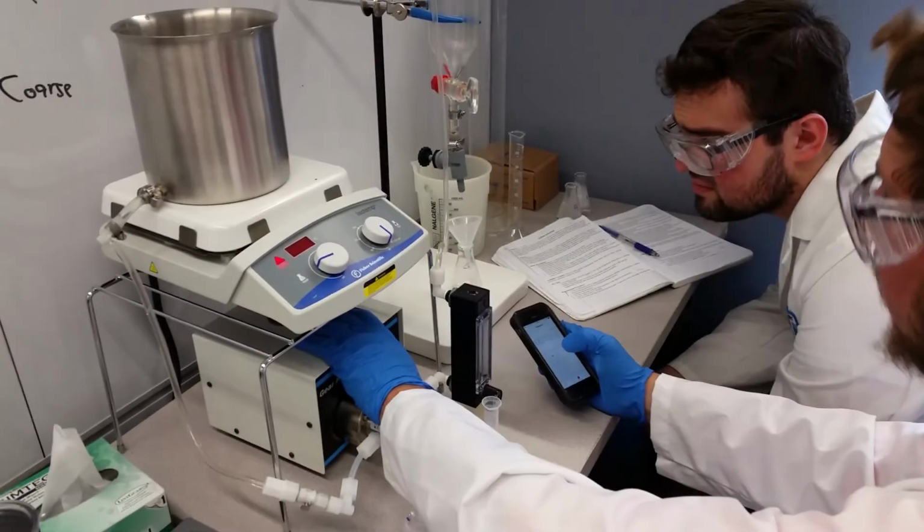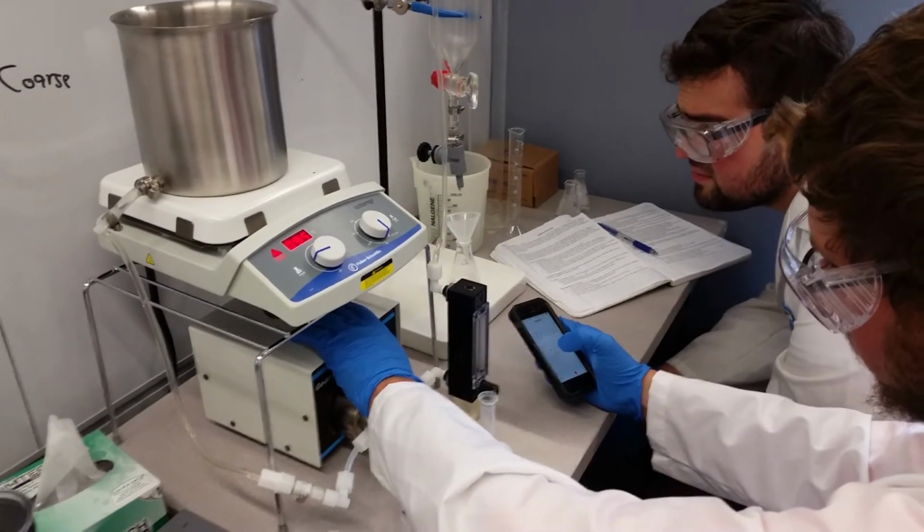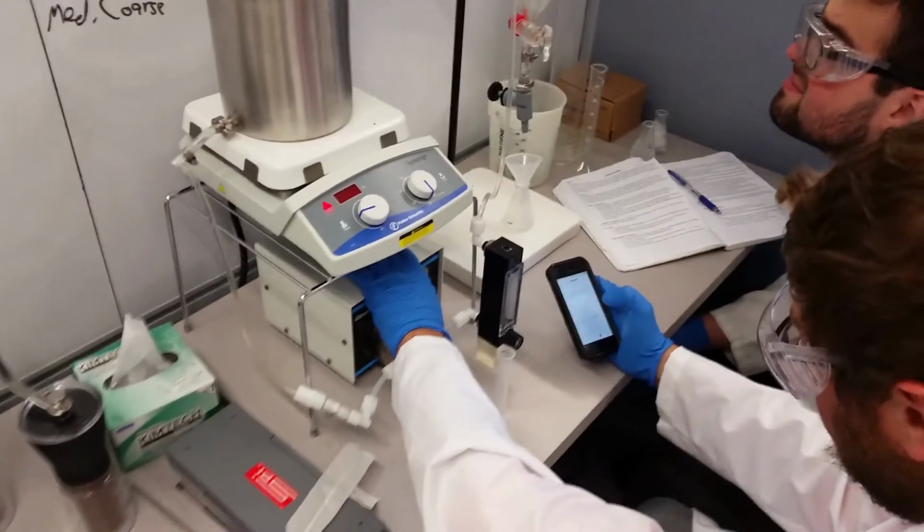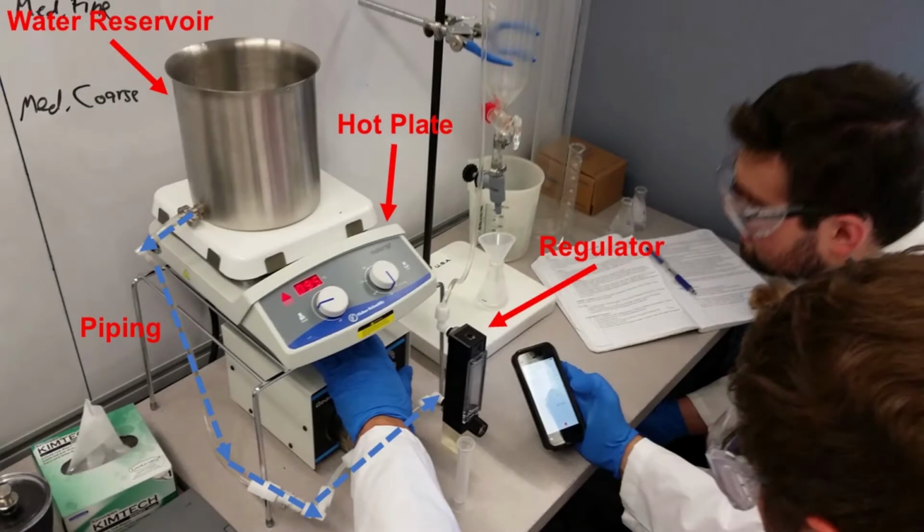So now looking at our reactor setup, we have a metal vessel on top of a hot plate that we use to heat 3 liters of water that will be used during the experiment. The water runs through a small plastic pipeline into a pump, where the pump pumps it into a regulator, which allows us to regulate our flow.